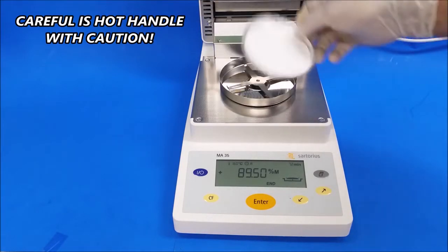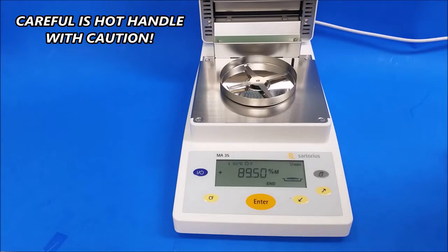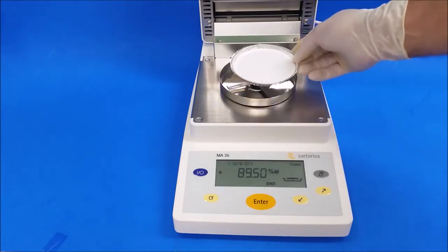Don't use these again. These are trash. Just get rid of it. Always get a new one. Start with a fresh one.